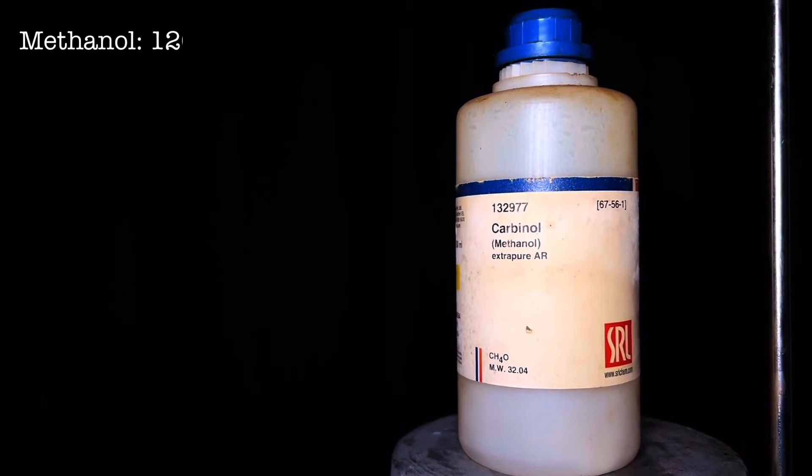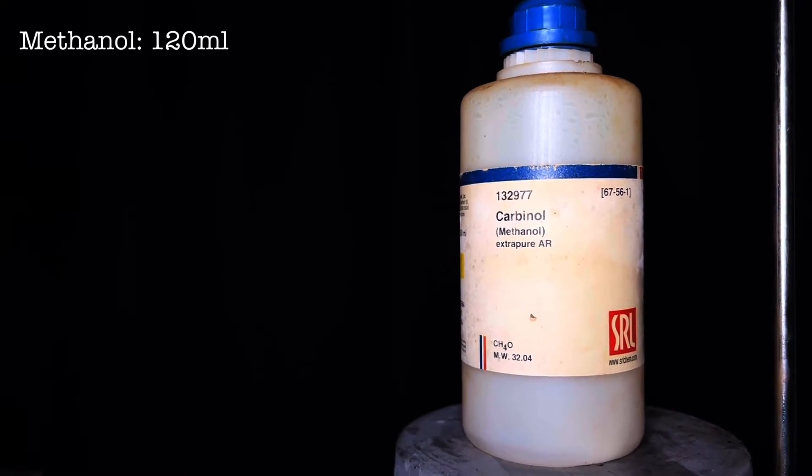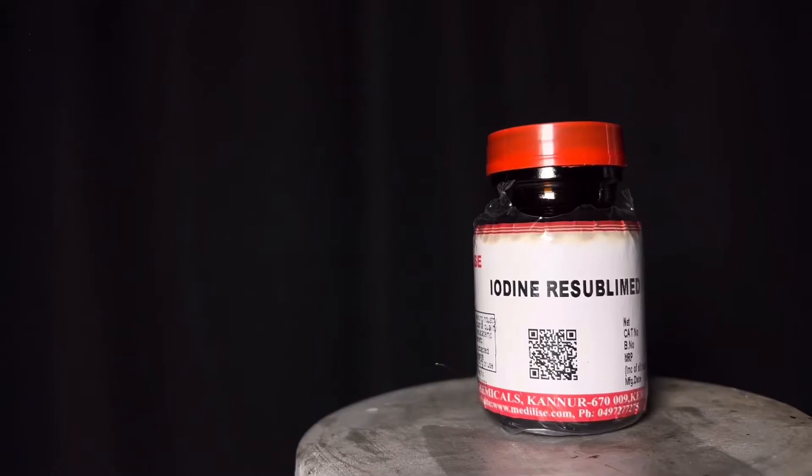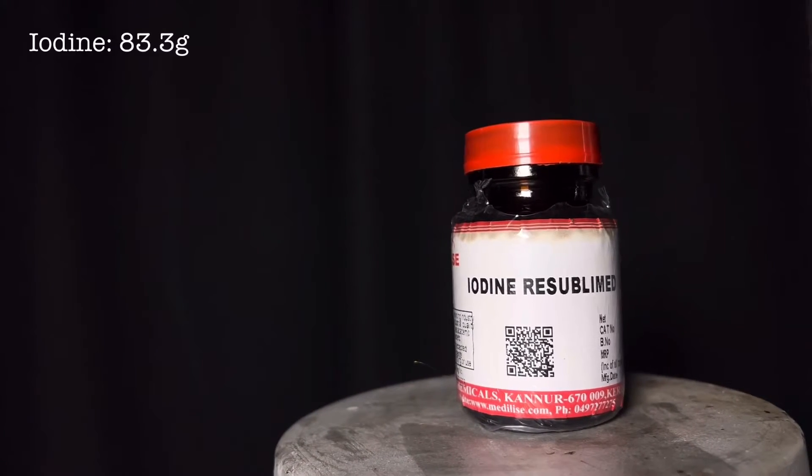For this synthesis you will need 120 ml of methanol, 42.3 g of red phosphorus, and 83.3 g of iodine crystals.